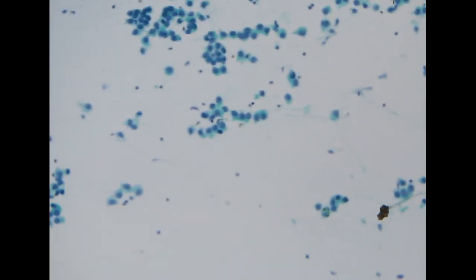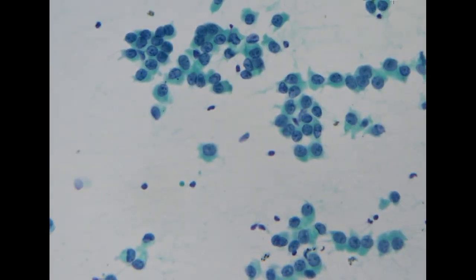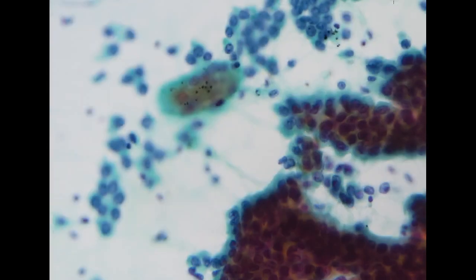So the next specimen is coming from lung. This is an aspiration specimen, a touch imprint specimen. We do have a lot of tumor cells, so we do have hypercellularity. The cells show nuclear atypia and are arranged in a glandular, rosette type of pattern. So this is consistent with adenocarcinoma, and the morphology looks like primary lung cancer.